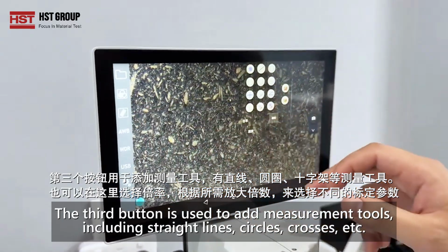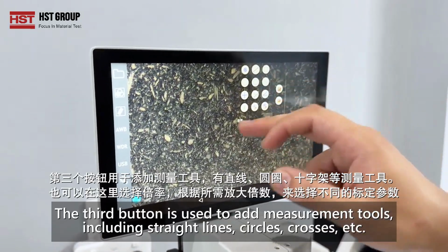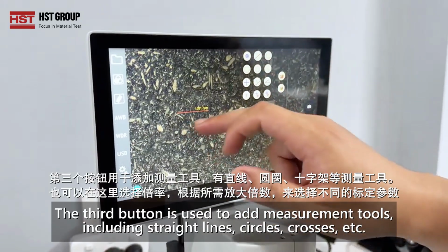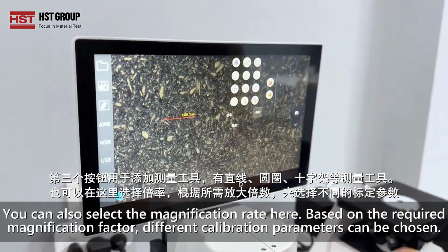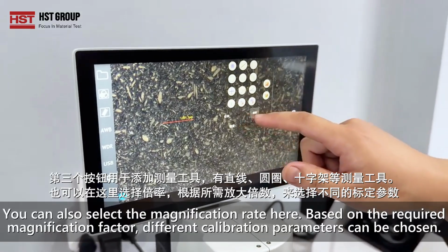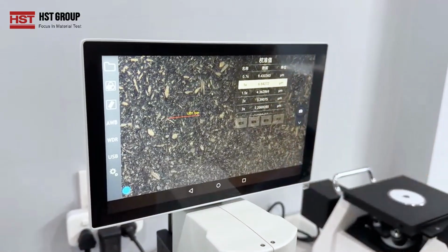The third button is used to add measurement tools, including straight lines, circles, crosses, etc. You can also select the magnification rate here. Based on the required magnification factor, different calibration parameters can be chosen.